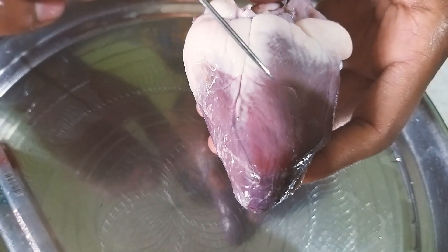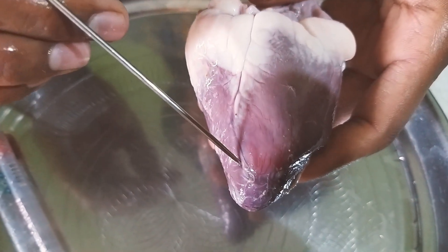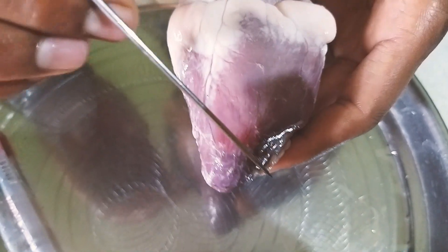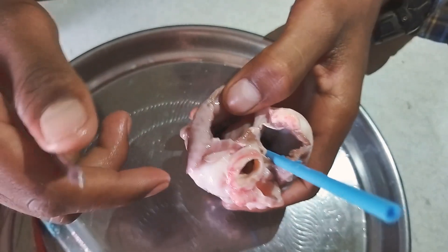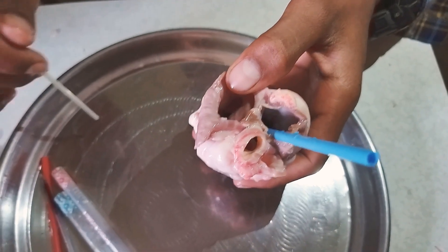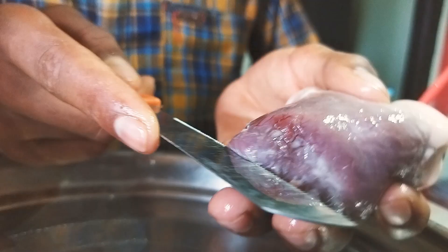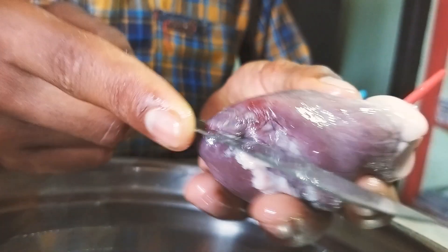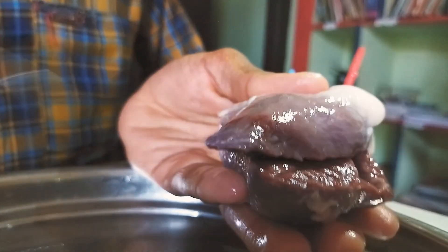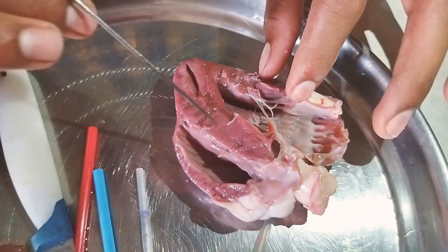We know that the heart has four chambers: the right atrium, the right ventricle, the left atrium, and the left ventricle. Let us observe the four chambers of the heart. Here, after cutting the heart, these are the four chambers of the heart.